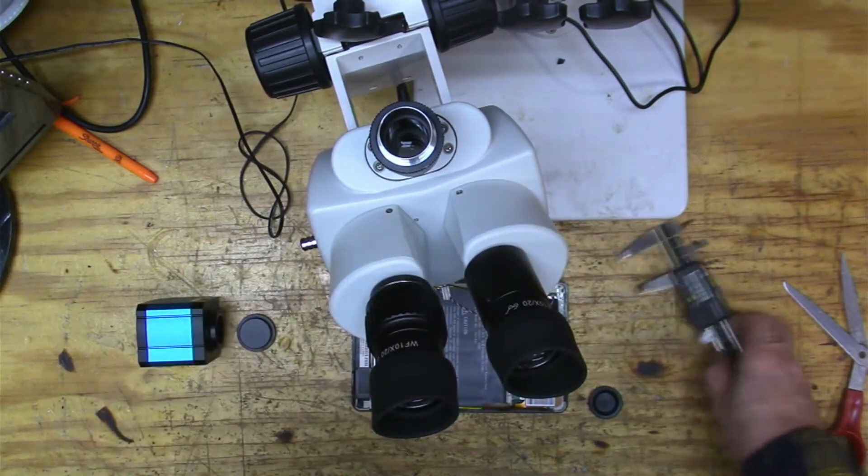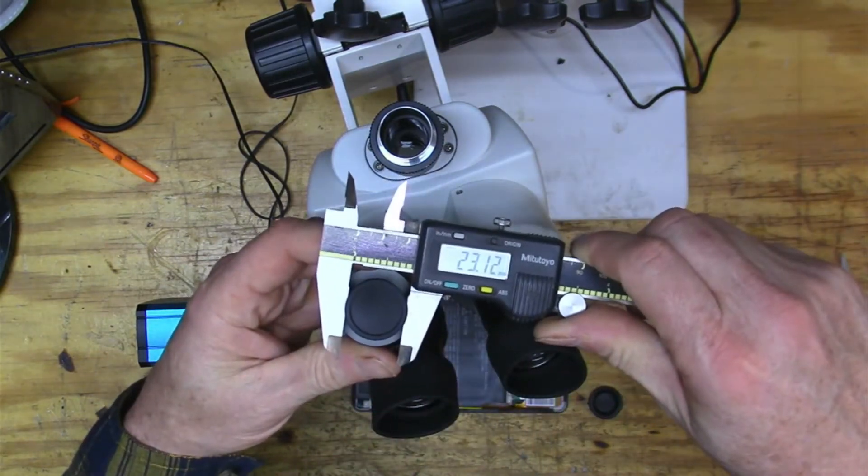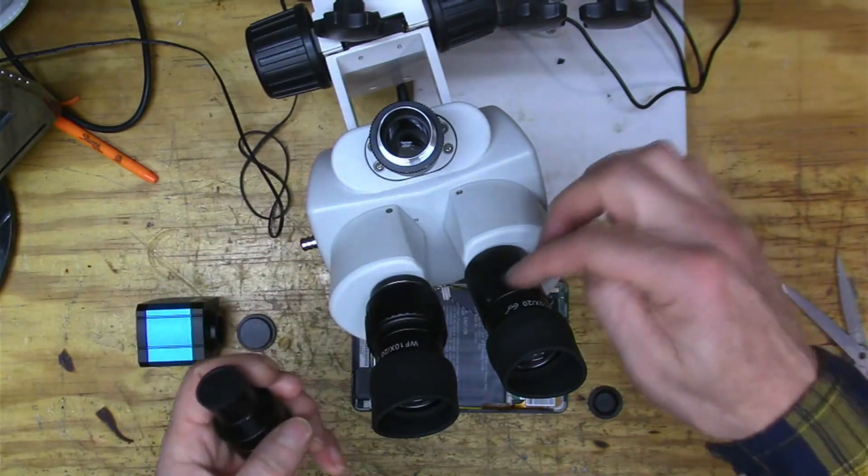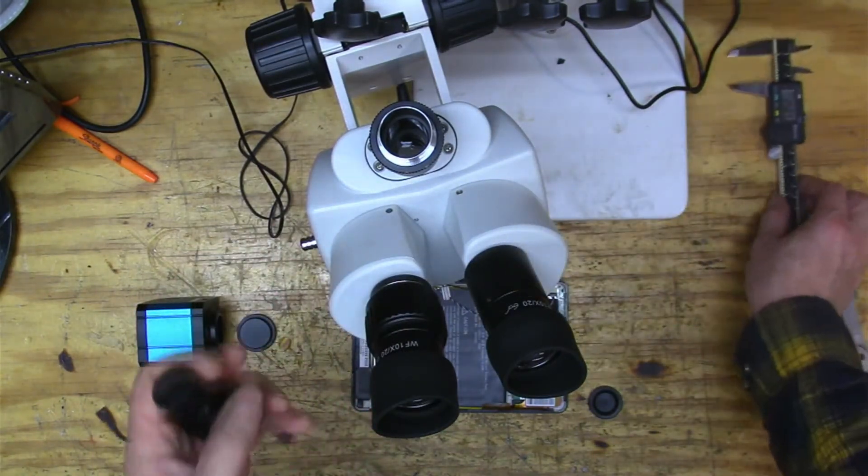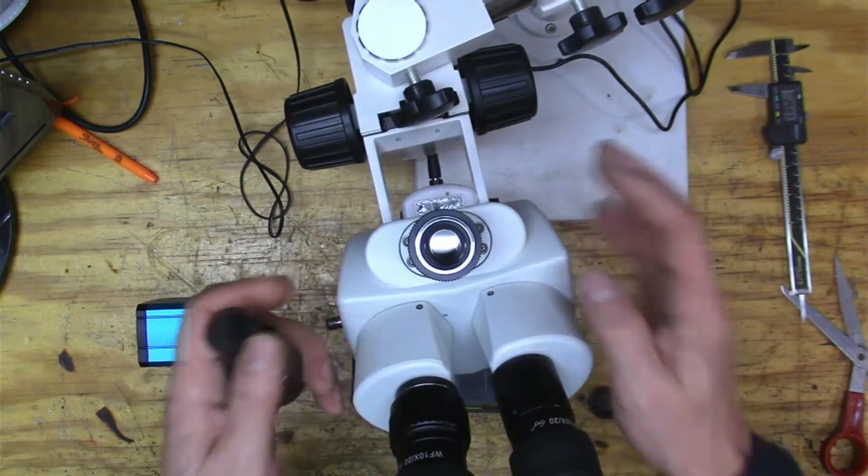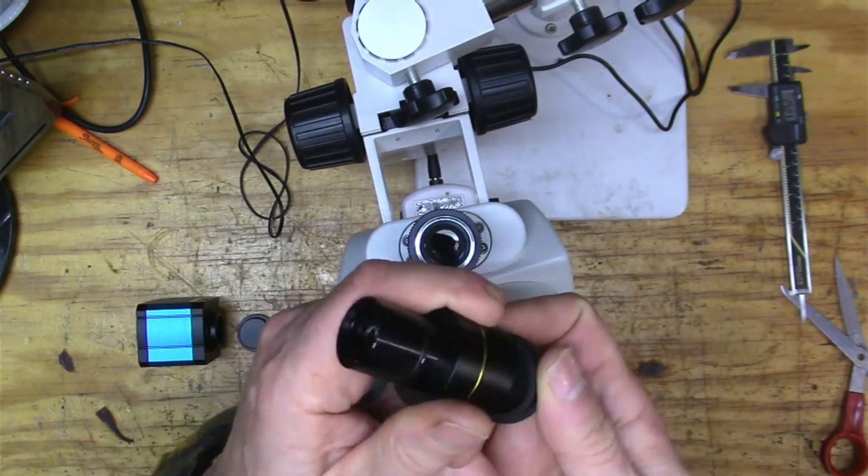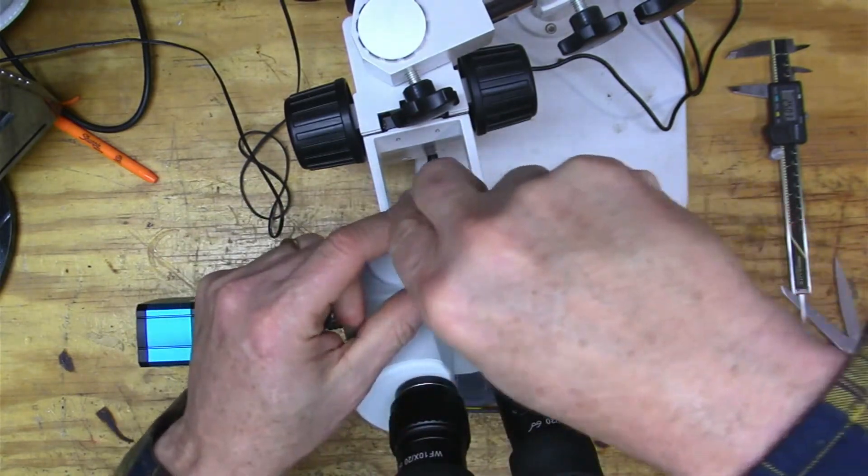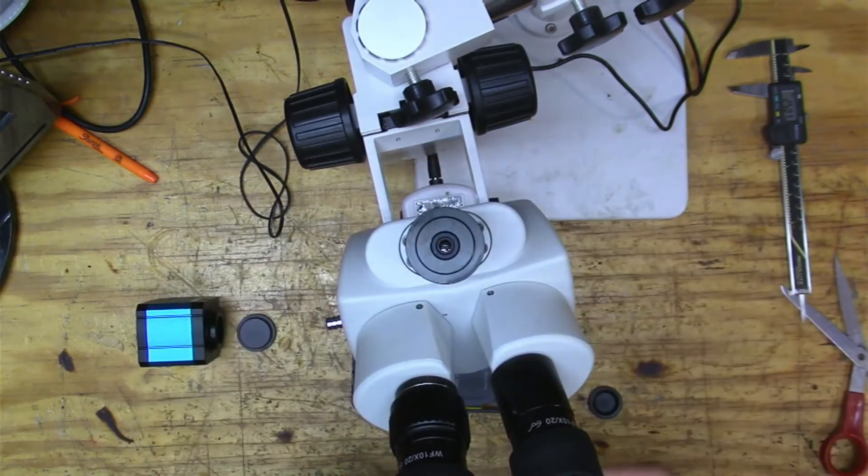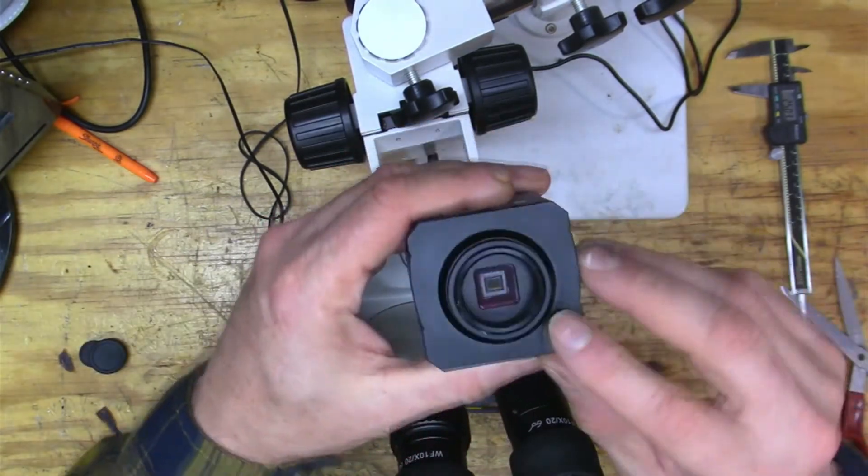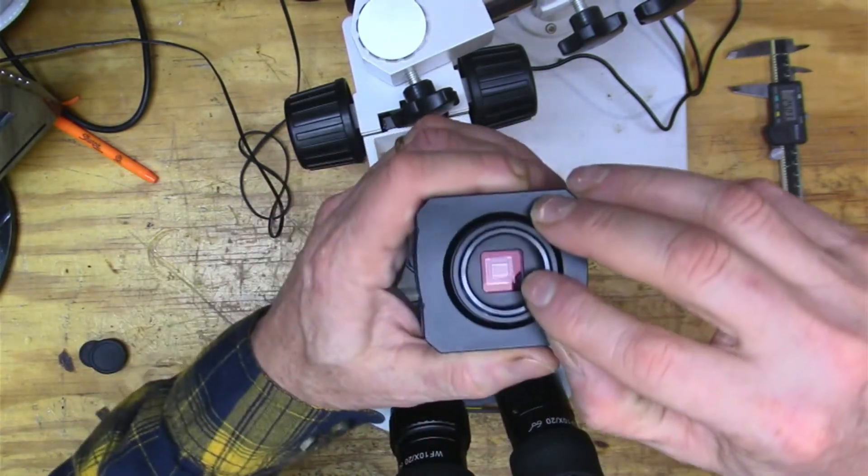If it's got what is the size, this is a little over 23 millimeters. So if you have a 23 millimeter port, I think it can fit in there. I'm not exactly sure about that. But when you buy this guy, it's got some lensing in it, right? And then some lensing in here, and then that just slides in like that.